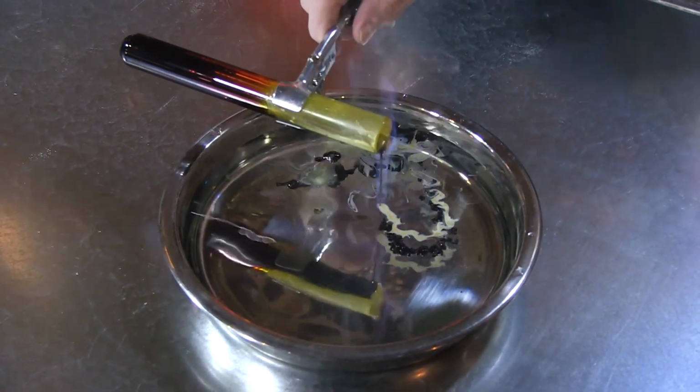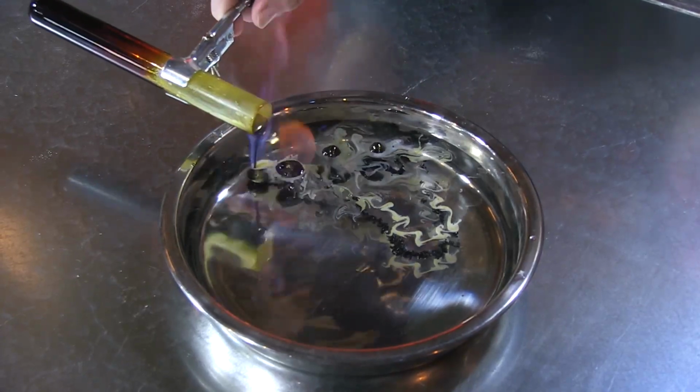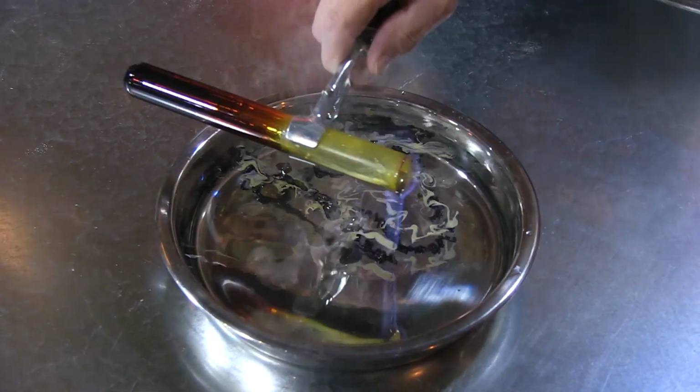And boy, those molecules were moving around hot. They're cooling off, and when they cool off, they slow down. Now those molecules that were in groups of 8 split apart, and they were moving around like that, and then I froze them in place just a little bit with that cold water.